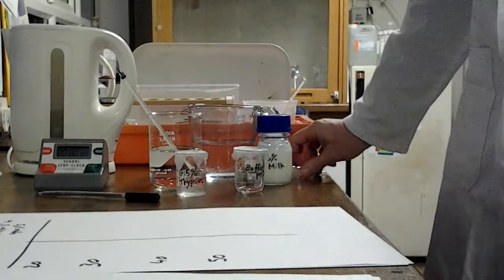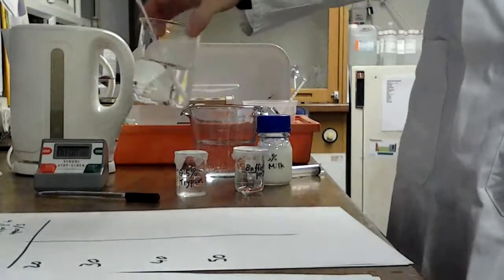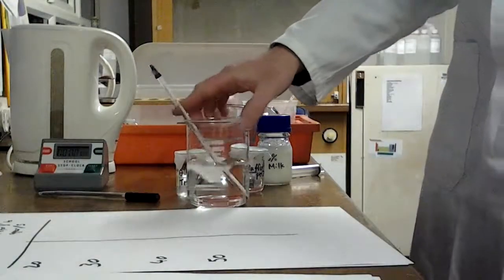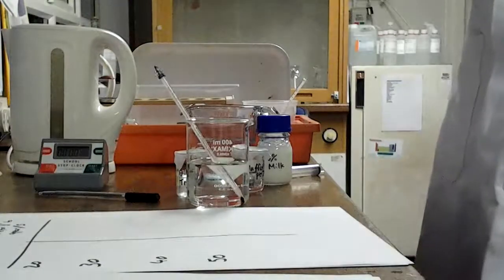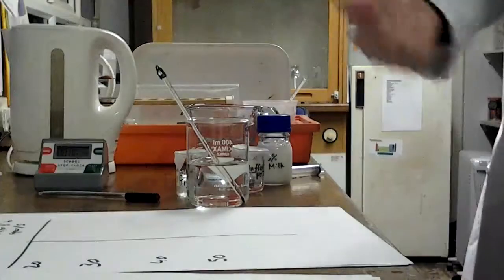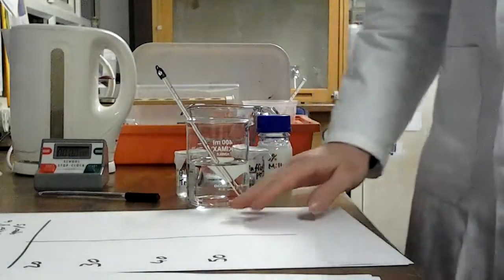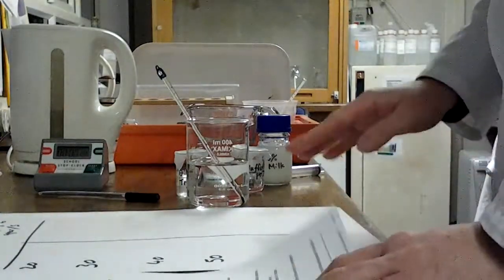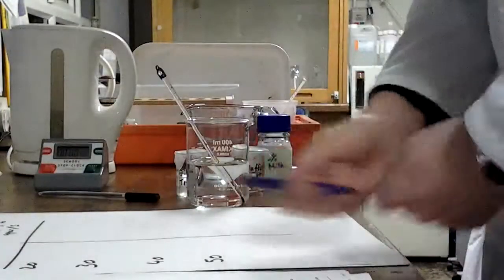Okay, so as temperature control is really important for this, we're going to be using a water bath. This is our water bath. It's not very high tech. It is a beaker with a thermometer in it, and I have a kettle with which I can add hot water. The range of temperatures we've chosen to use in this is from 20 to 50 degrees, going up in 10. So we're going to do 20, 30, 40, 50, and I suppose if we have time we could always do 60, but we're going to start aiming for those. So 60 I reckon is our absolute upper limit on this one.